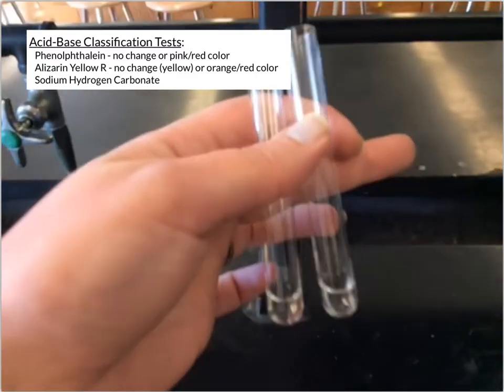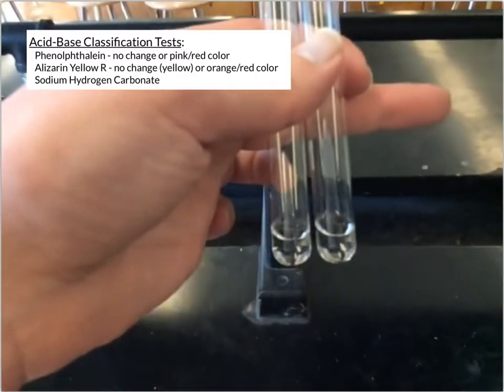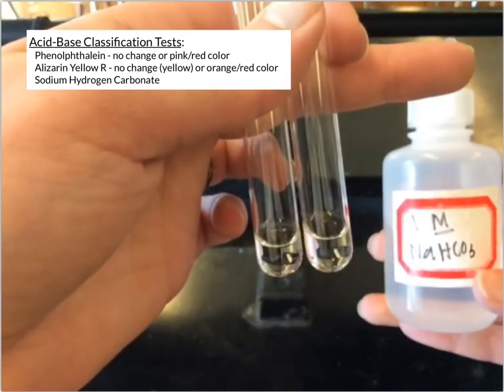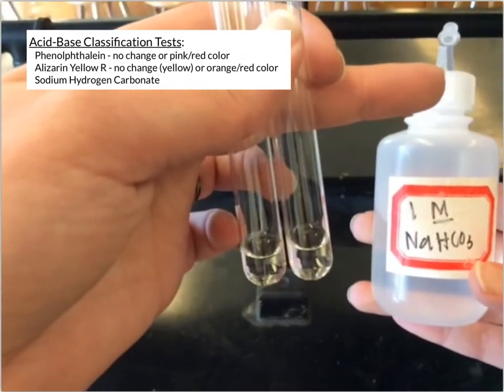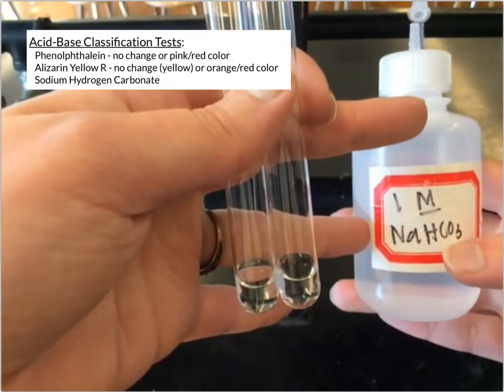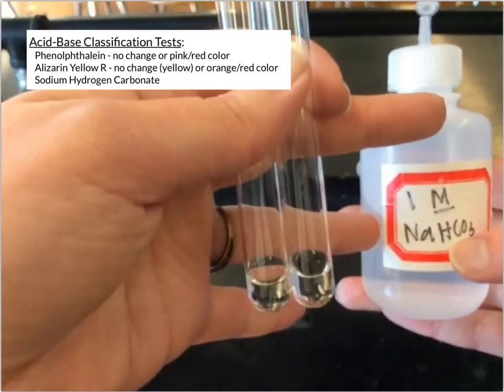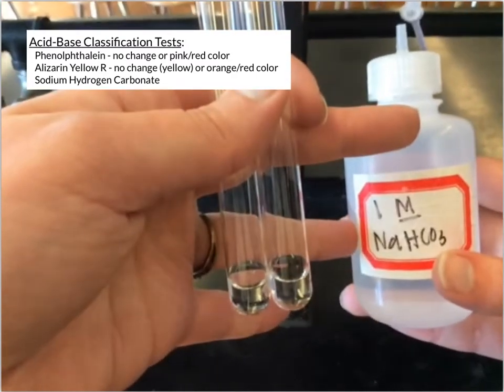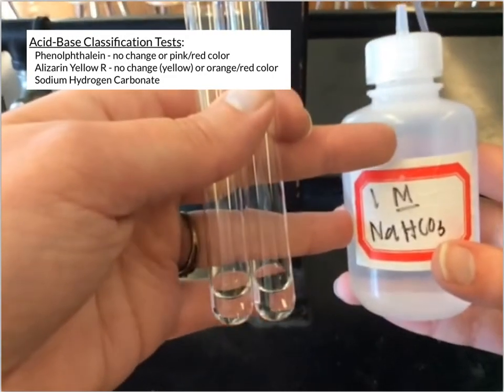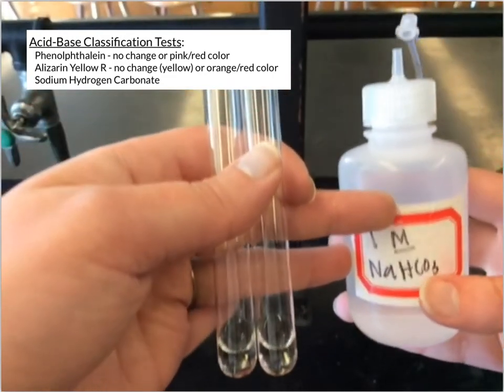Okay, so our final test, we're going to take 2 clear solutions here. We're going to test them with sodium hydrogen carbonate or sodium bicarbonate, and that's because when we have carbonate substances or bicarbonates, when they react with some substances, they'll form CO2 gas, and that all depends on the acid-base characteristics.